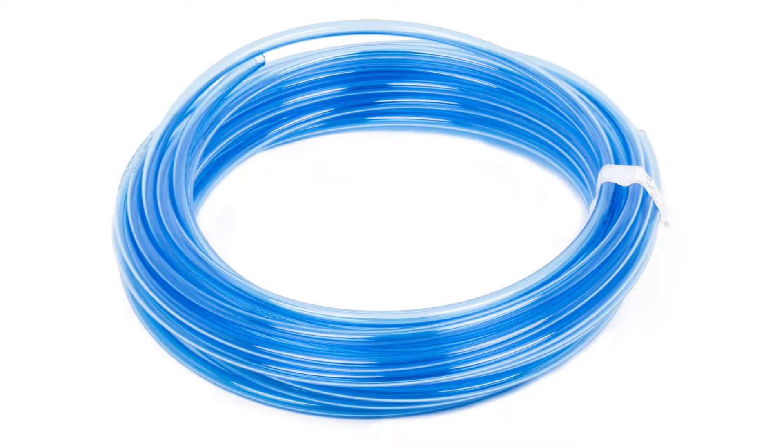It also includes 4m of polyurethane tubing to connect the autosampler to a dry air source. This helps to prevent any buildup of condensation when using the well plate.